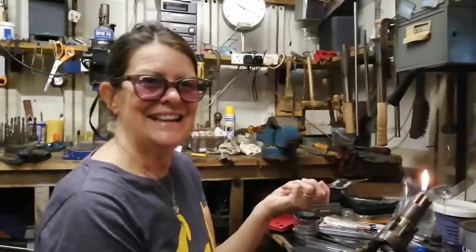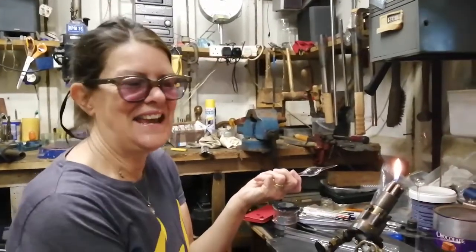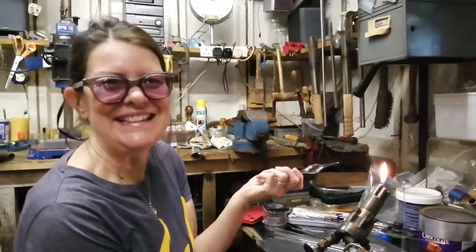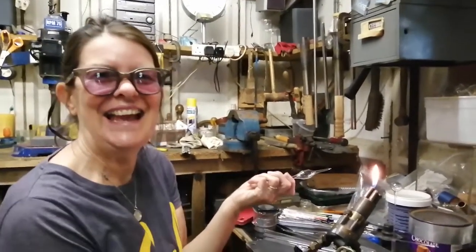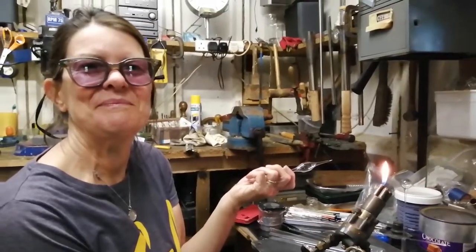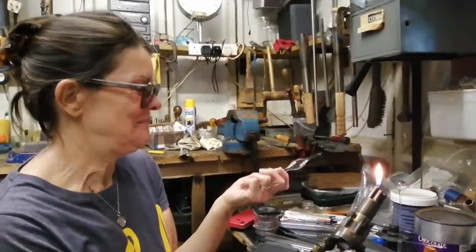Thank you. Hi, I'm Carolyn, and I've never done this before, so I'm very interested to see how you do it. Well done, Caroline. Right, the first thing is you're going to show people how we just practice turning the glass. So if you could just show that, please, Carolyn.